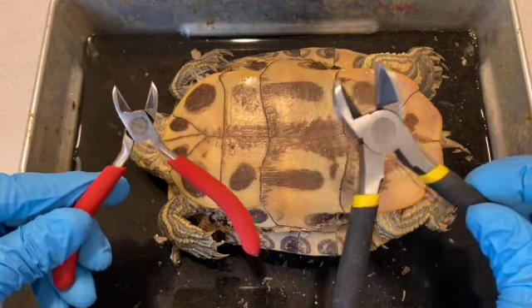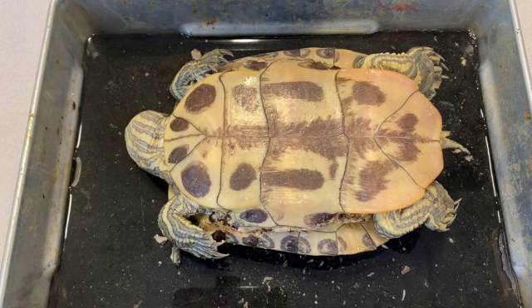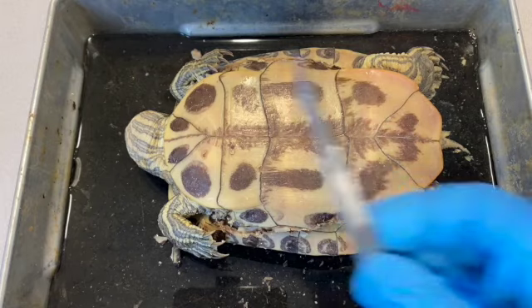You'll need to do this on both sides of the plastron to cut through and make sure that you are able to separate entirely the bridge from anterior to posterior all the way. Now, just because you cut through the shell and that bony material in that shell does not mean it's going to come apart easily. So some other tools that I recommend: one is a scalpel.